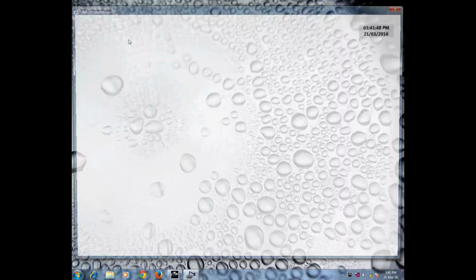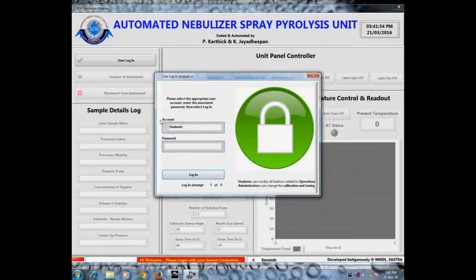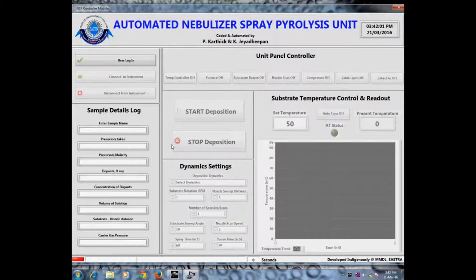The software should be accessed with correct login credentials which were created already for a particular operator. The software already has an admin login through which only the calibration and tuning of the instrument can be done. The sample details must be given for logging purposes and also for recognizing the samples in future. Only after successful log entry can the instrument CPU be connected from the software.